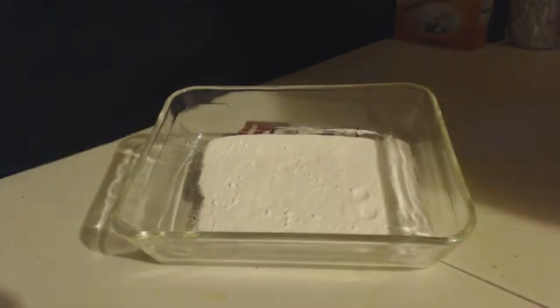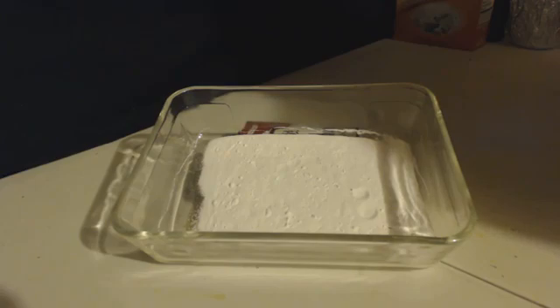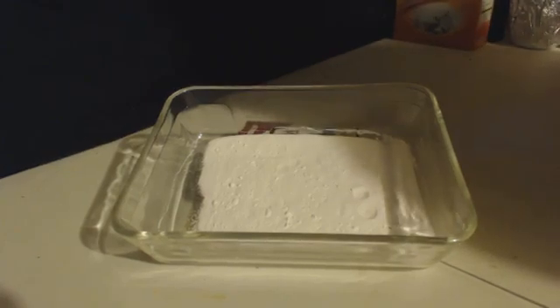My suggestions after doing it this way with just a little bit—I used to fill it up a whole half inch, this time I barely covered the bottom of the tray—my suggestion is this: only put it in a millimeter high and use a really big dish, as big as you can get.